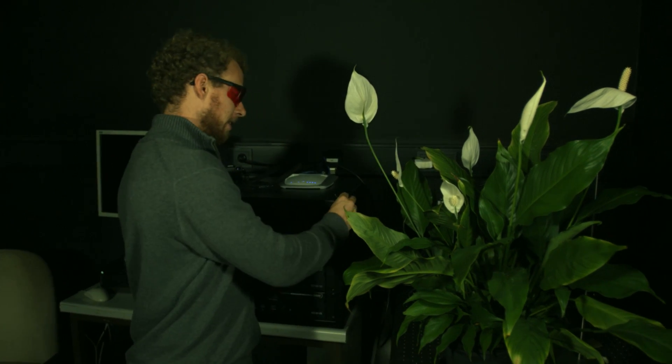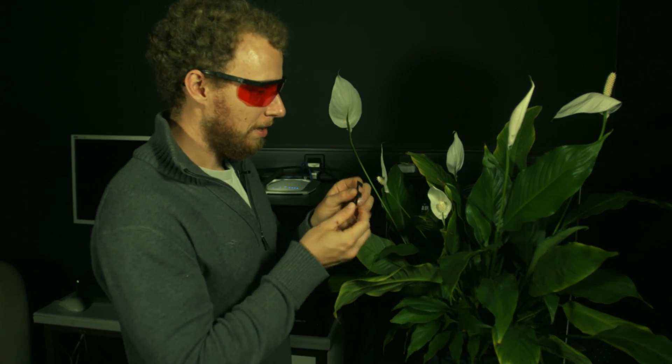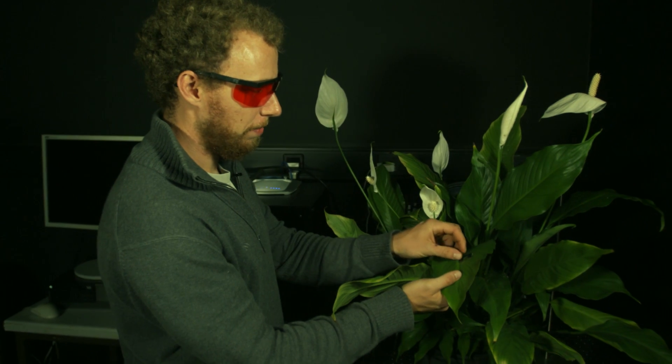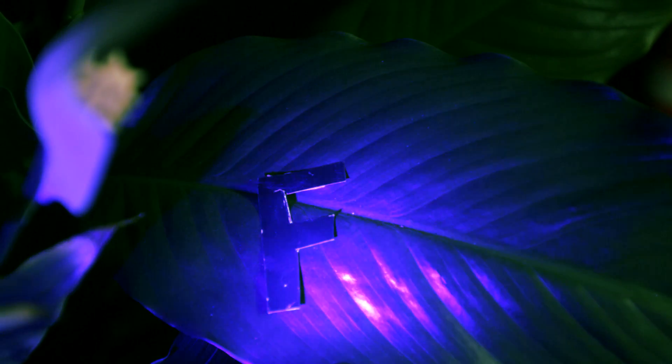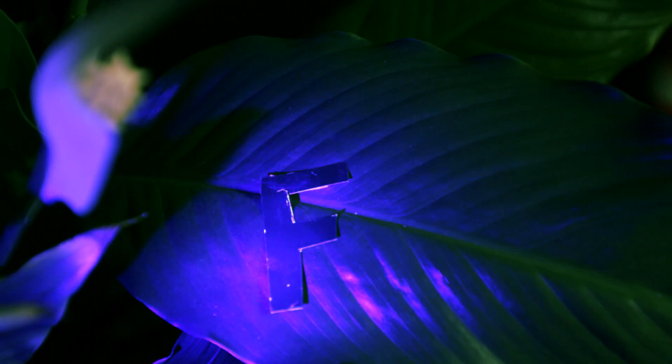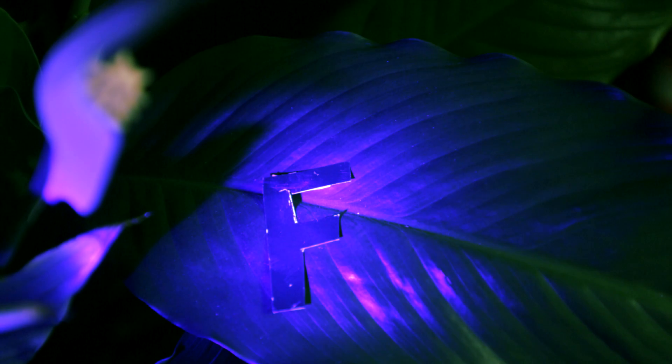Using the fluorescence we can now show with a little experiment how plants adapt to light and darkness. With this little F we cover a part of the leaf and shade it from the light. And then just using the blue flashlight we adapt the plant to high light conditions.